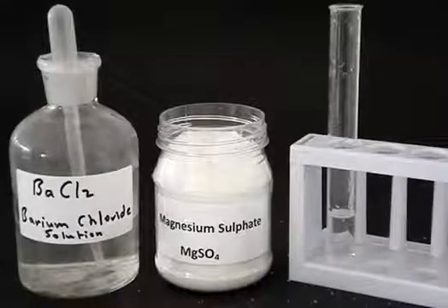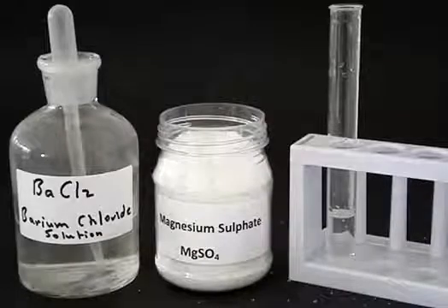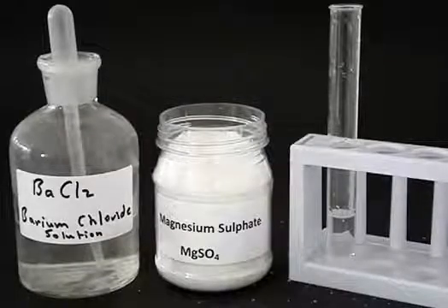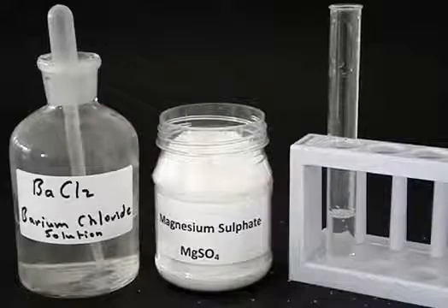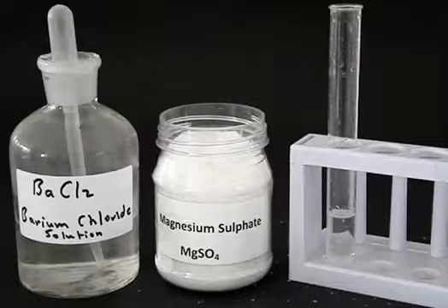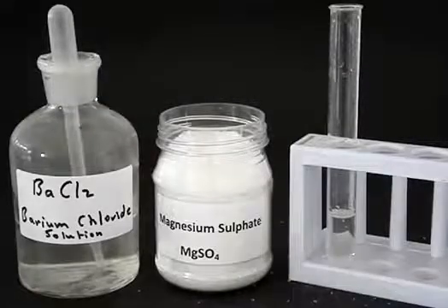If we take a look at that, we can't really tell what it is, because it just looks clear. We could even think it might be pure water. And so we need some kind of test to show up what the substance is.